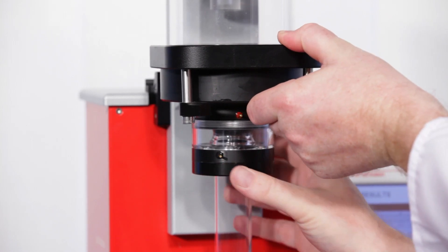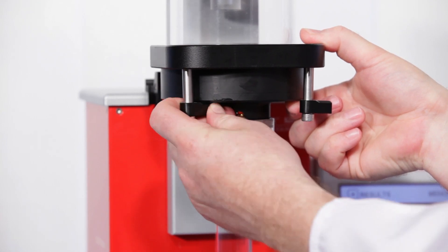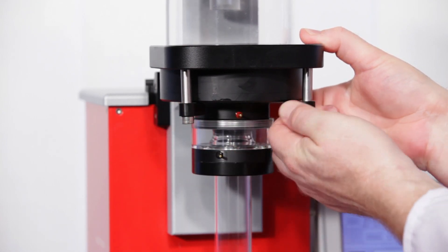Then, push the front part of the cell into the catch of the overflow vessel, and tighten the two locking bars.